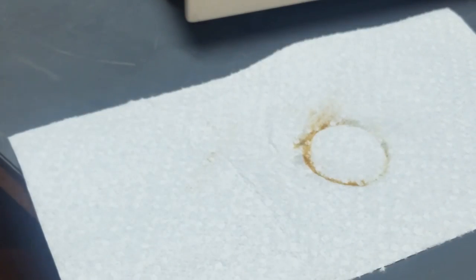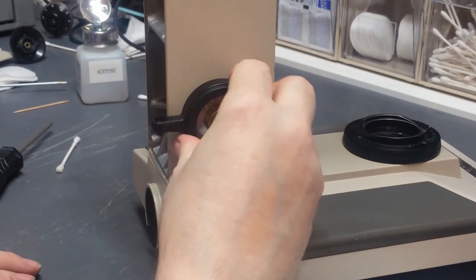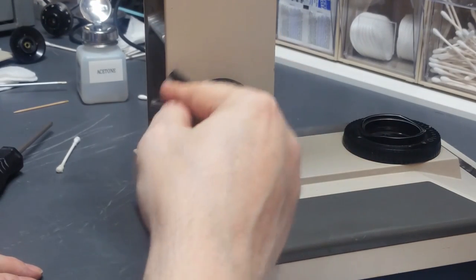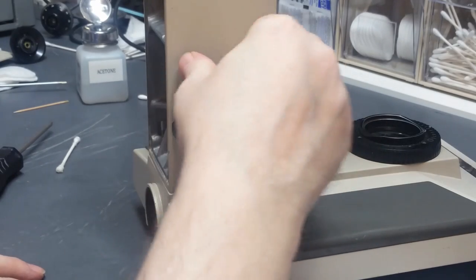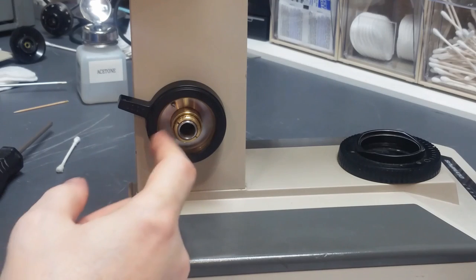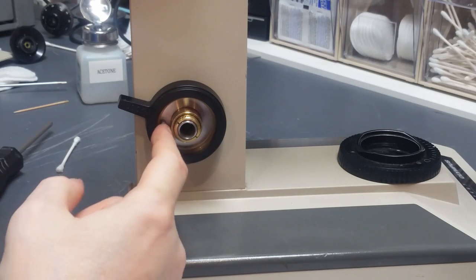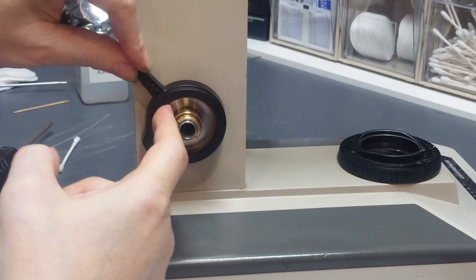Okay, so now what I do is I reinstall this knob, rotating clockwise to get the threads engaged. Now if the knob is loose, if I reach in, grab this pin, this disc should rotate freely. If the knob is tightened, it should hold it.